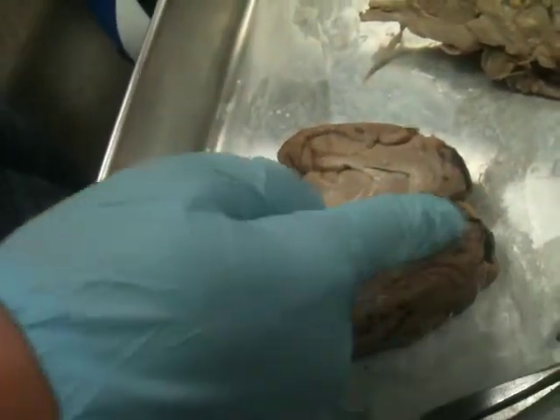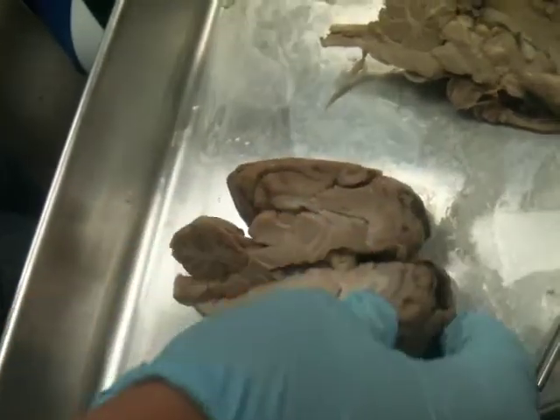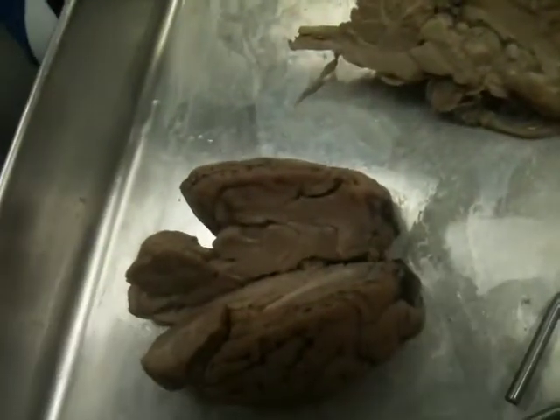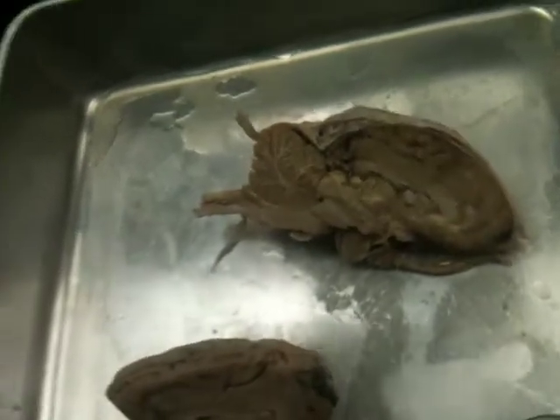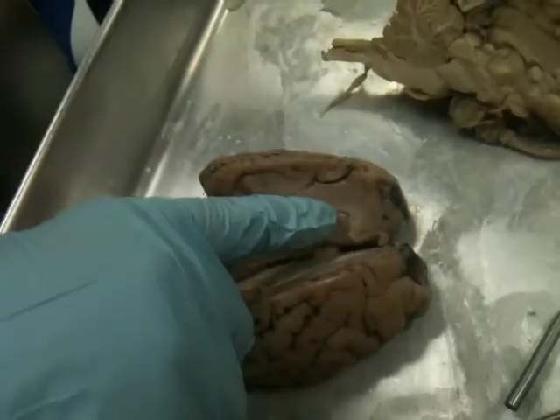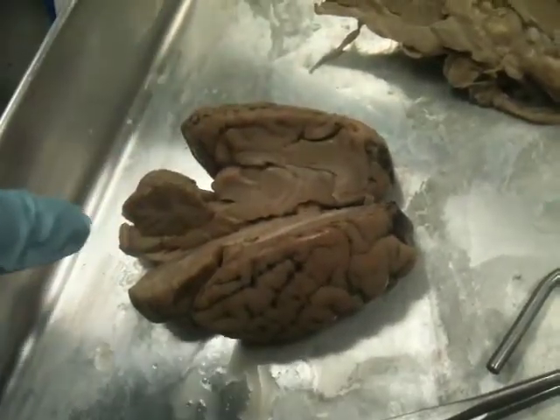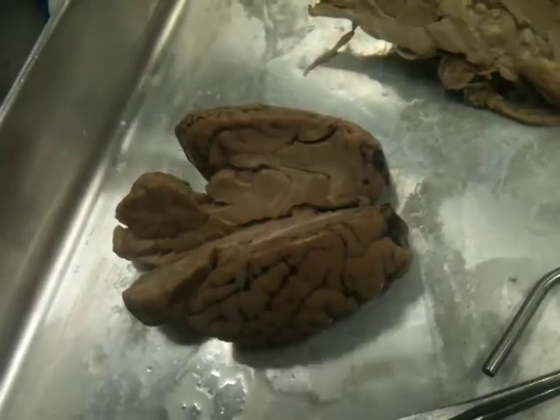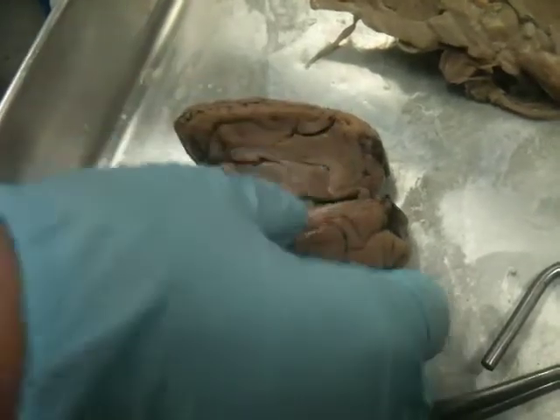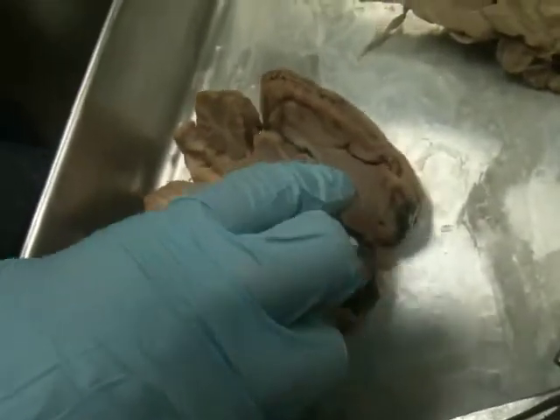So you see underneath the corpus callosum, you have this opening. Okay. You can see it there too. That's the lateral ventricle. Ventricle just means a chamber filled with fluid, right? We'll see it again when we get to the heart. So in this case, the fluid filling it is the cerebrospinal fluid. So remember, inside the ventricles is where I said you could find the choroid plexus, which we can't see, but that's what's actually going to be producing that cerebrospinal fluid. Which is inside of the lateral ventricle, right?